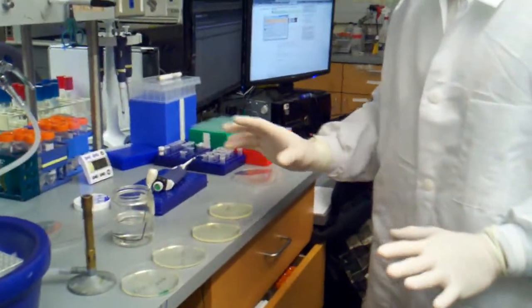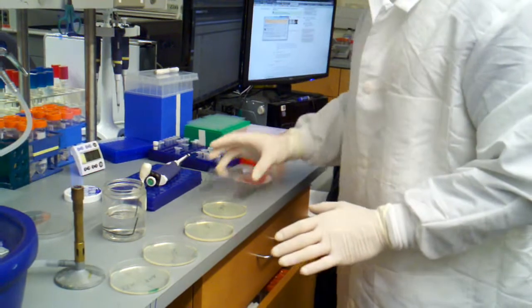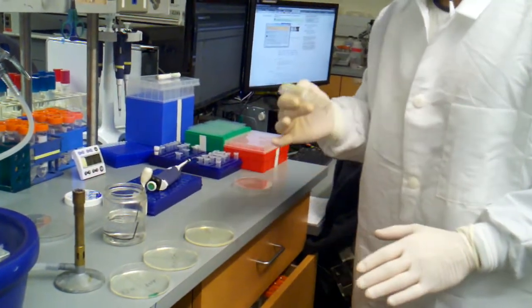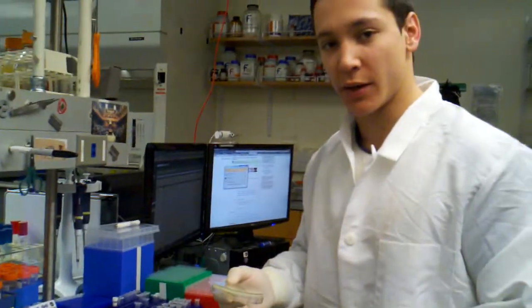So I'm just going to let these dry, I'm going to cap them. So cap them like that, put them upside down in the incubator. And that's a complete transformation from start to finish.